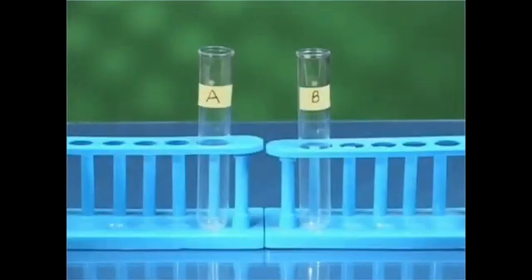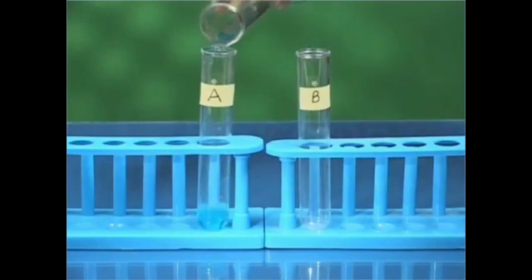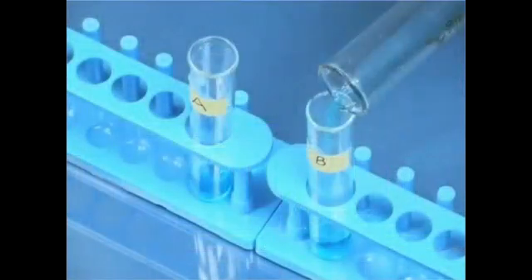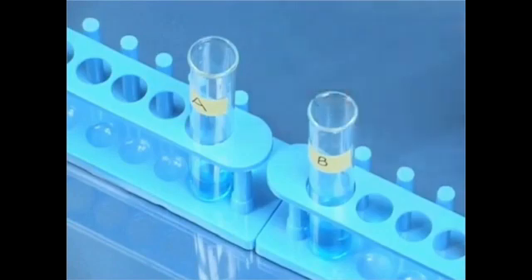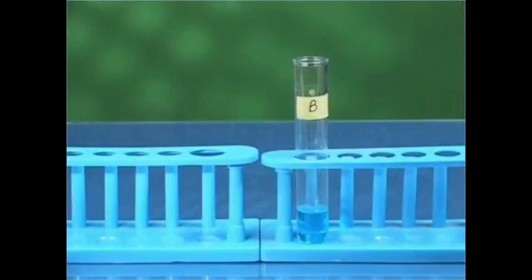Take two test tubes, mark them A and B, and in each test tube pour some amount of copper sulphate solution. Fix test tube A on clamp stand and keep test tube B as a sample in test tube stand.